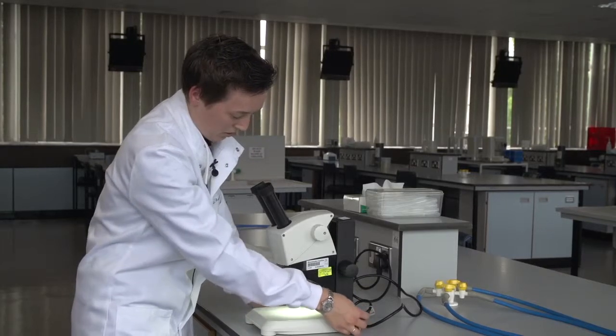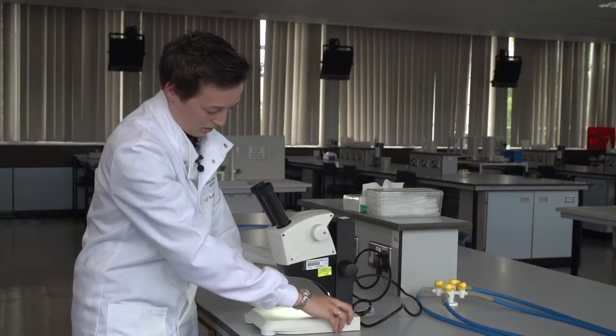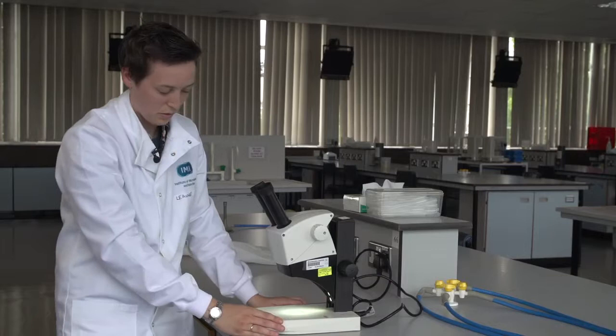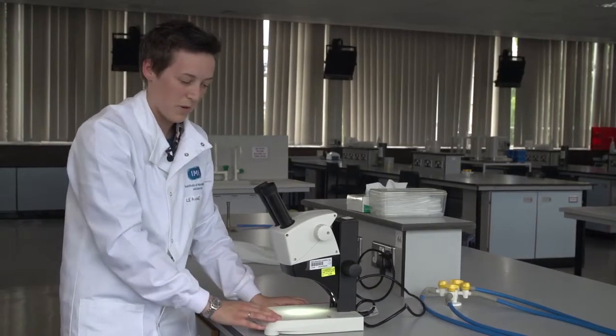For what I'm going to show you today I'm going to use the top lighting because I'm not looking at a transparent specimen.